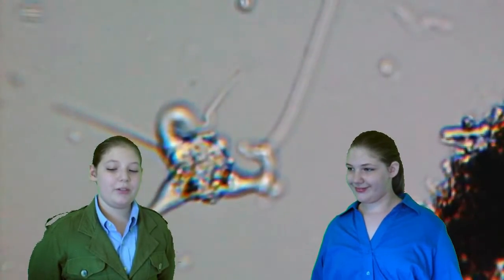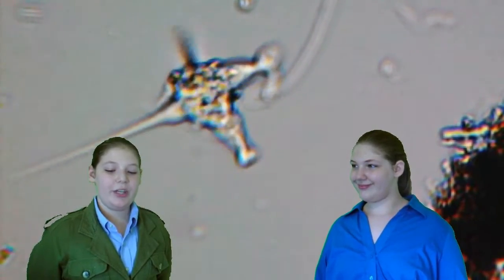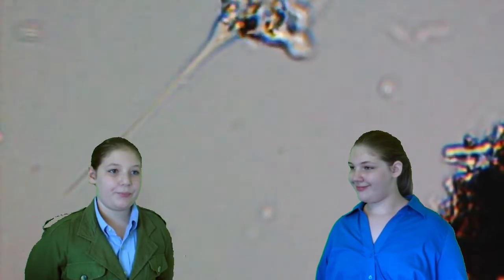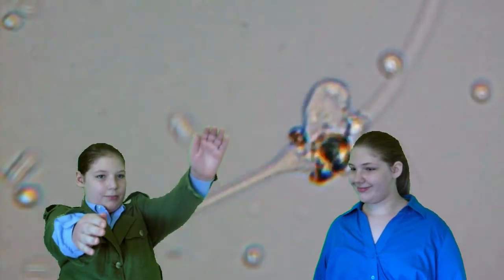We really wanted to find an amoeba, but we had no idea what this was when we recorded it. It turned out to be an amoeba in its free-floating state, called an amoeba radiosa. It's reaching out with pseudopods trying to find something to attach to. Help me. We finally found an amoeba doing what we expected.